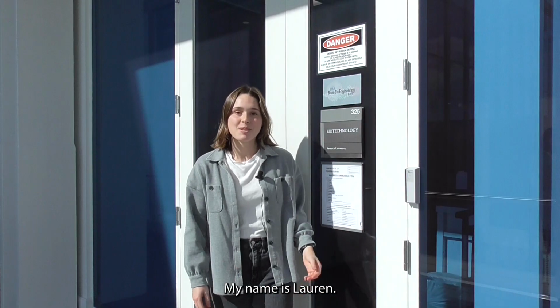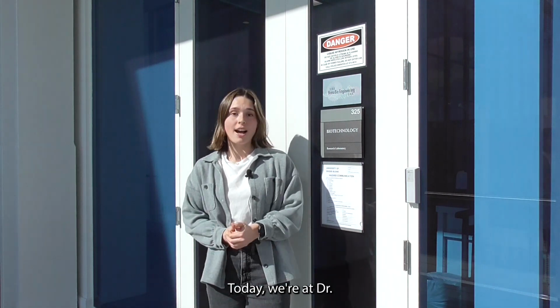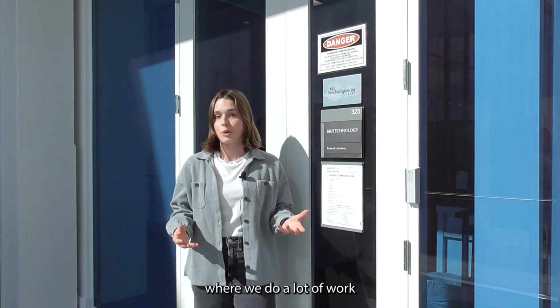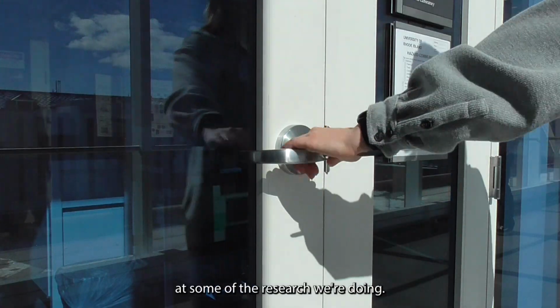Hi everyone, my name is Lauren. I'm a senior at the University of Rhode Island. Today we're at Dr. Roxbury's NanoBio Engineering Lab, where we do a lot of work with carbon nanotubes. Let's take a look at some of the research we're doing.